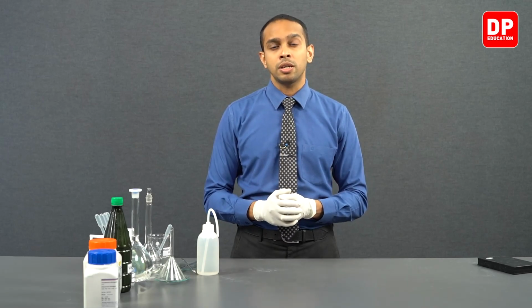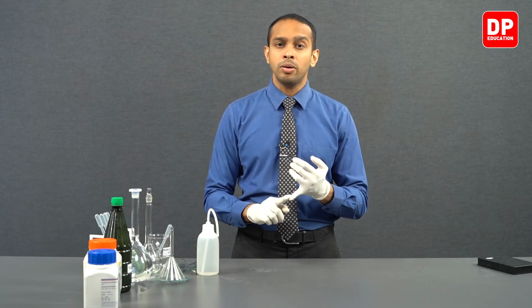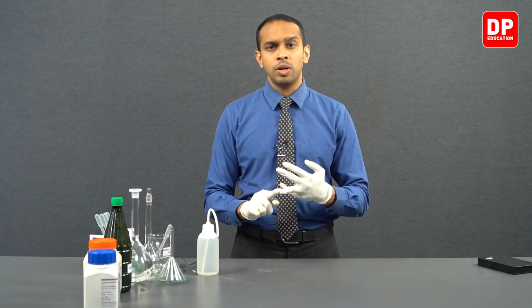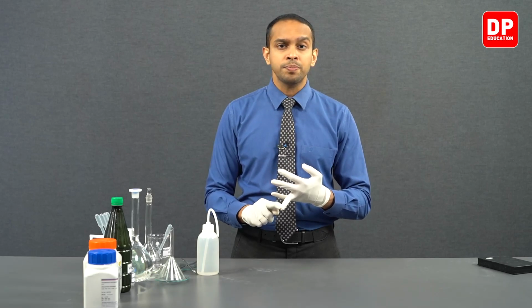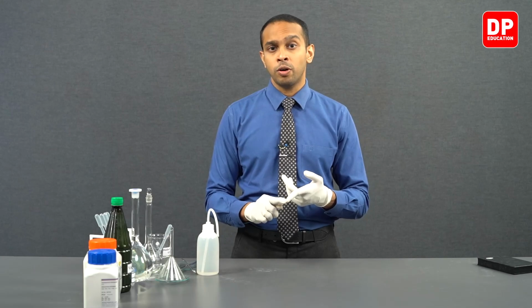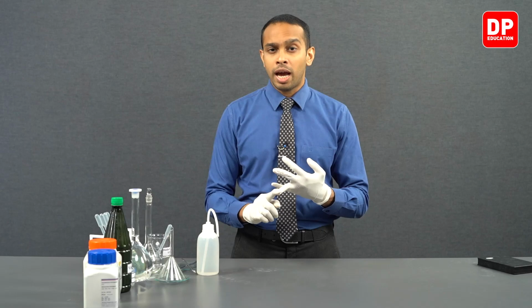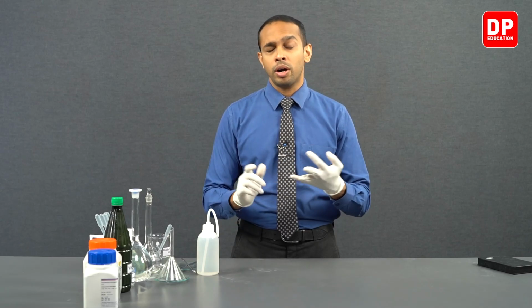However, a primary standard is a very stable compound which is not going to be undergoing any decomposition easily. So a primary standard is a stable compound and something that can be obtained with a high level of purity, and it is going to be non-hygroscopic, meaning it will not absorb moisture from the atmosphere, and it will have high solubility in water, and it is supposed to be non-toxic and should have a high molecular weight or high molecular mass to avoid the errors that are normally introduced through measuring a substance.